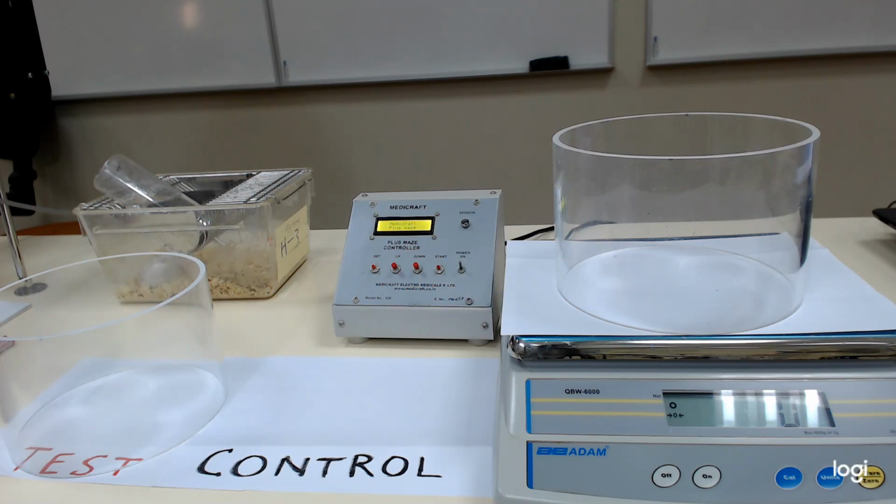Okay. So today, briefly, I will cover all those steps from beginning to end for performing this anti-anxiety activity. The basic things which we need are two groups of mice. The test group is where we will study diazepam at 1 to 2 mg per kilogram dose as an anti-anxiety drug using elevated plus maze.